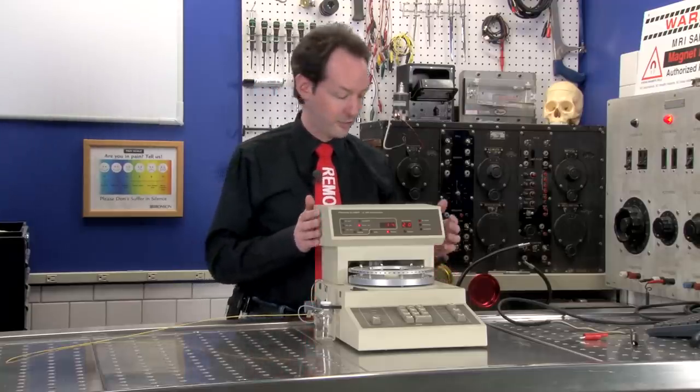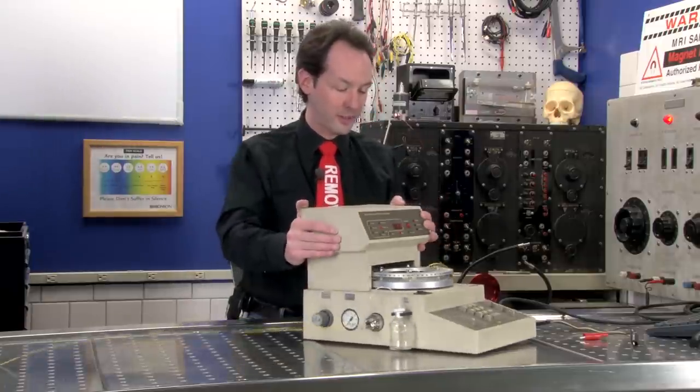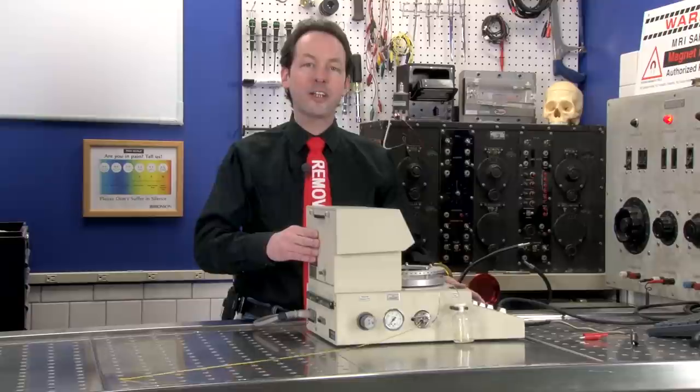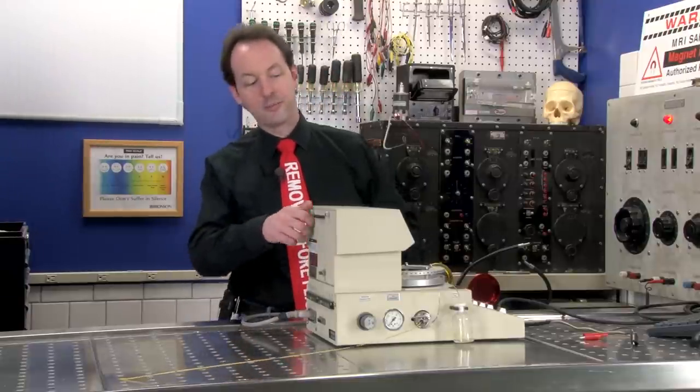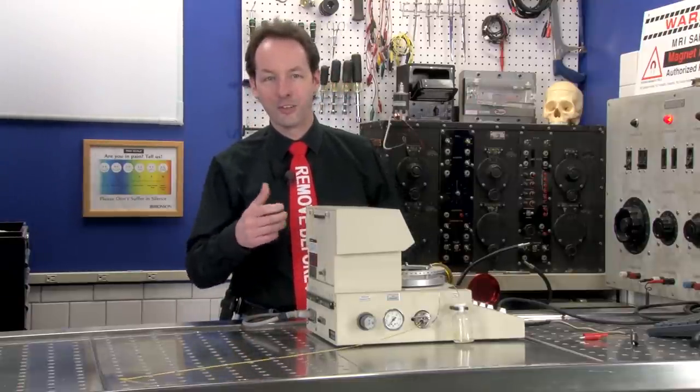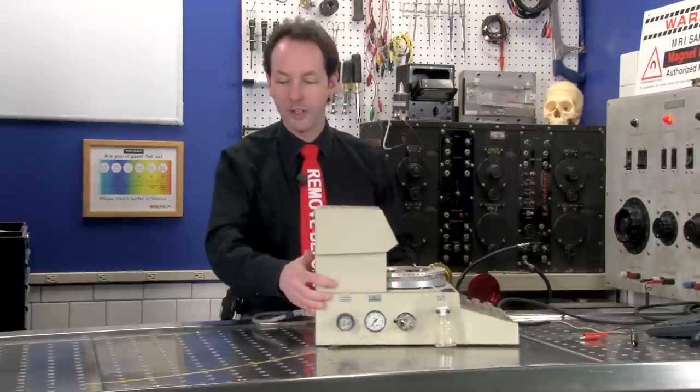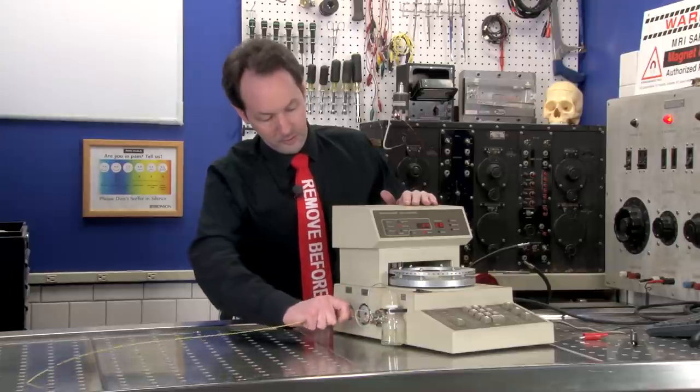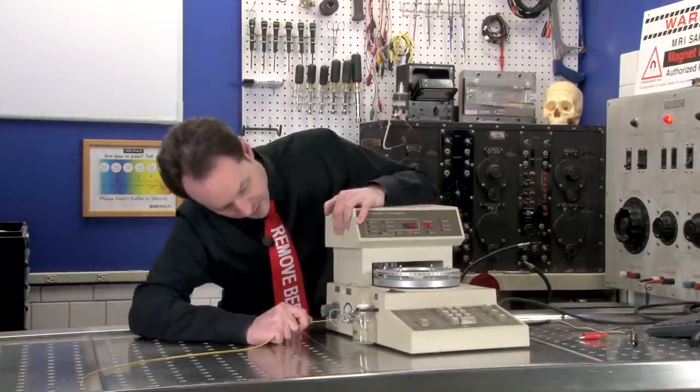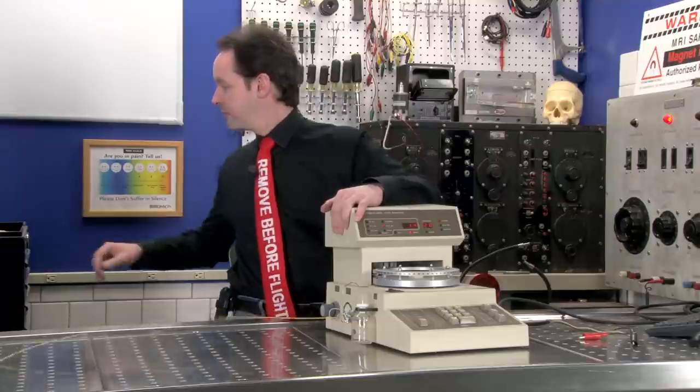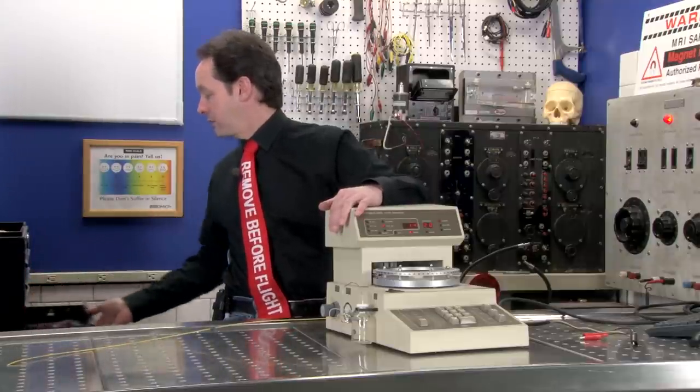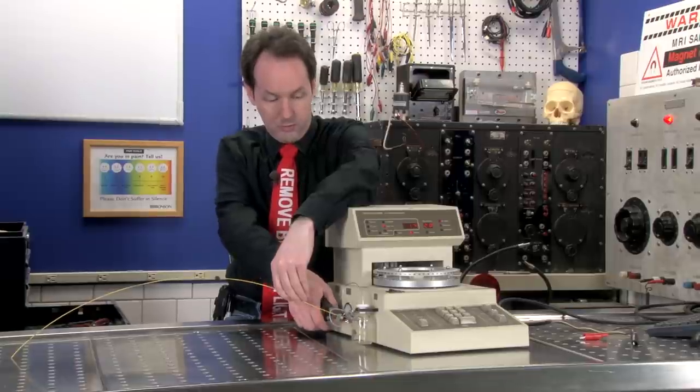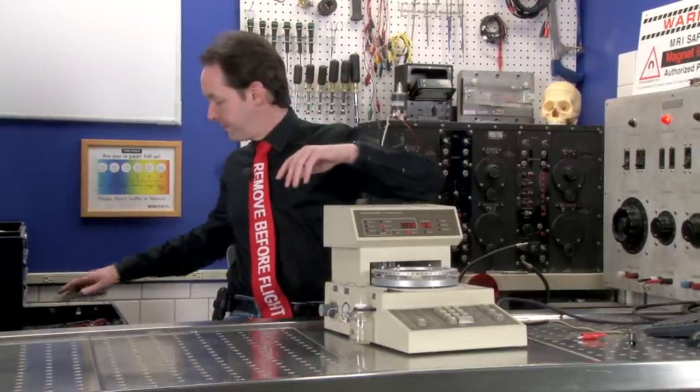We're going to find out how and why it makes the sound. But this is a thing used for chemistry, and that's everything I know about it. My profound understanding of chemistry is the stuff of legend. I'm going to get rid of this giant cat whisker off the side because it's just annoying me.